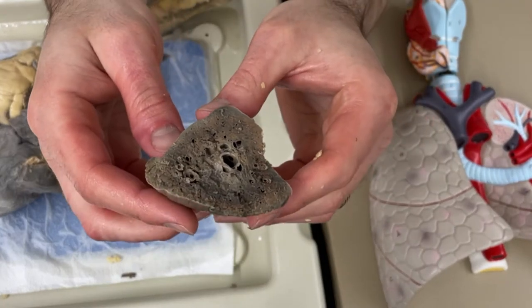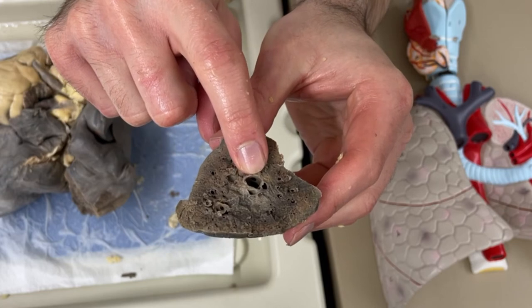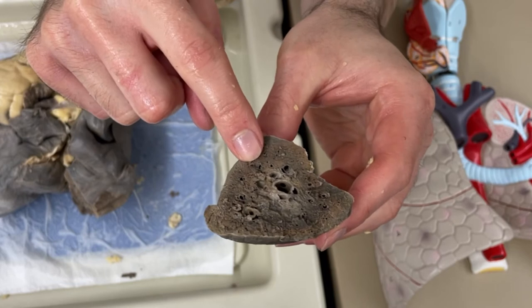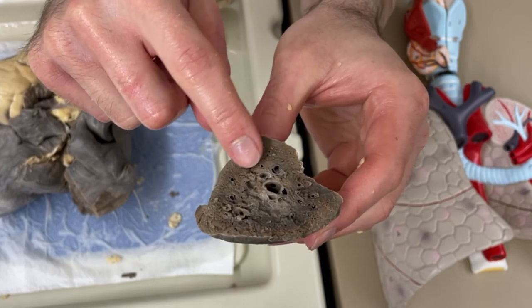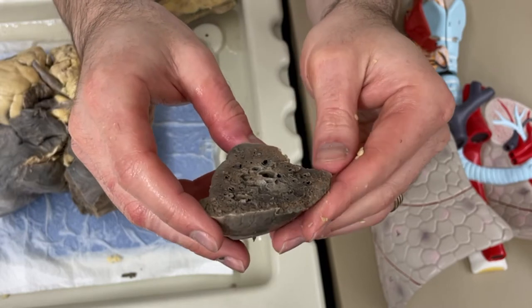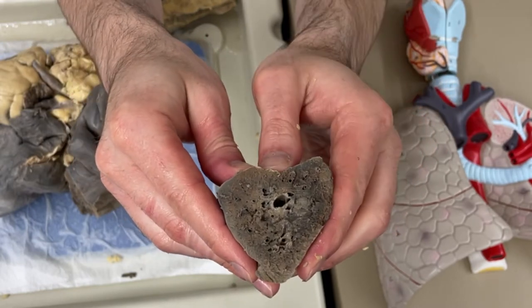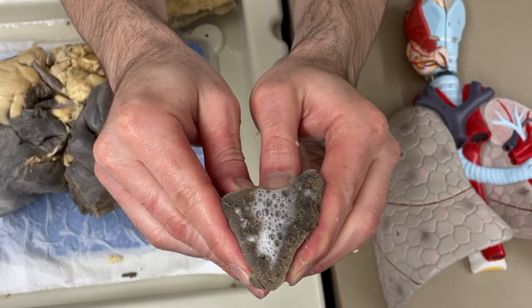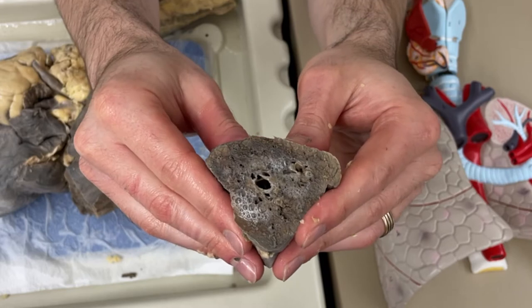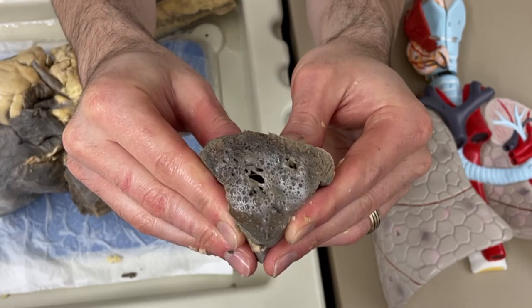In this section of the lung, there's a big hole right there which is going to be one of the bigger branches of those bronchi. And then you see lots of little holes - those little holes could be cross sections of little pulmonary veins or little pulmonary arteries. And eventually those end in alveoli, which are a little bit too small for us to see. But as I squeeze this, every little spot where fluid is coming out is going to be where air or blood travels in the lung.